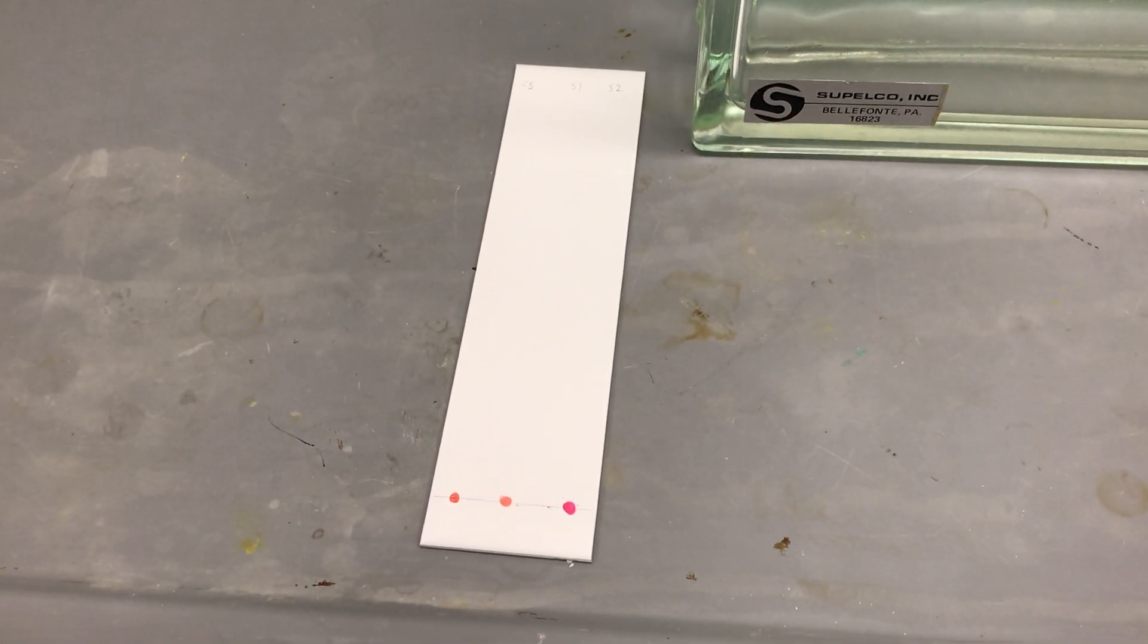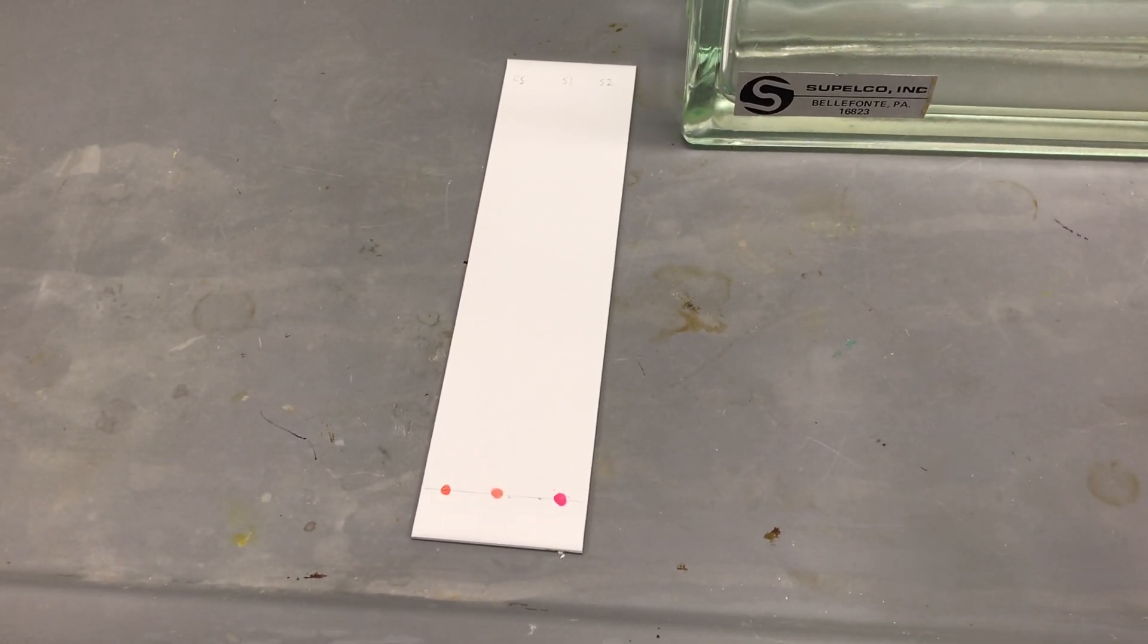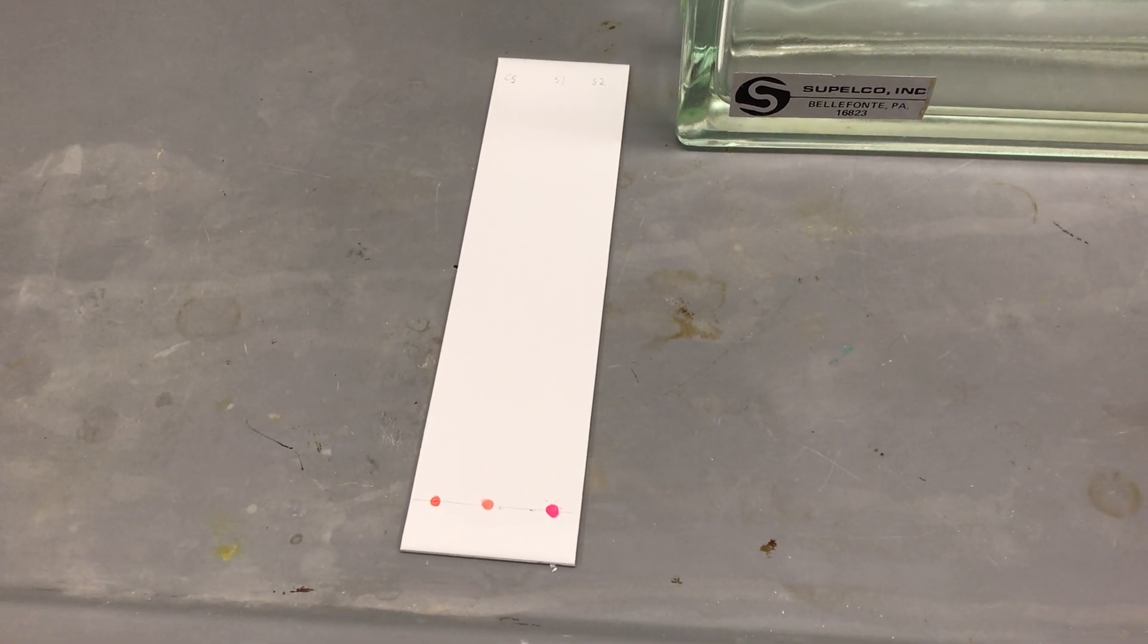And then start to spread them out up the face of the plate. Now remember, some of the substances will like the solvents a little bit more than others, and that means they will travel farther.